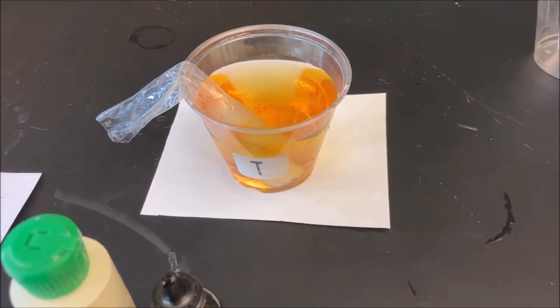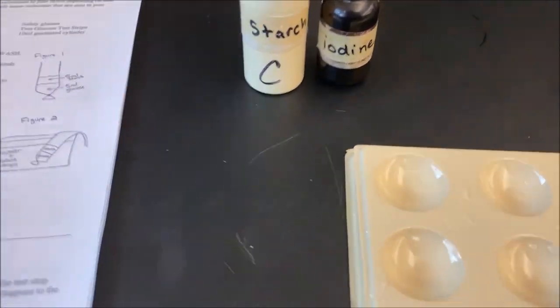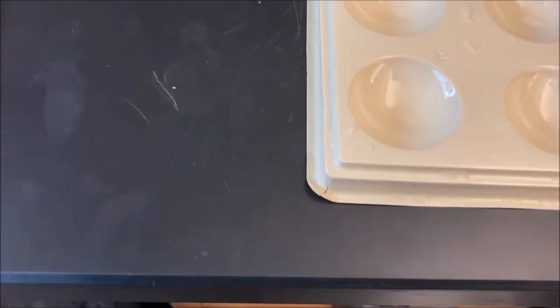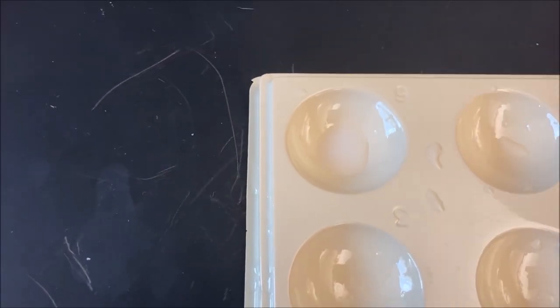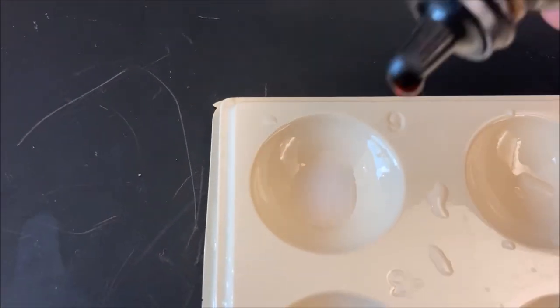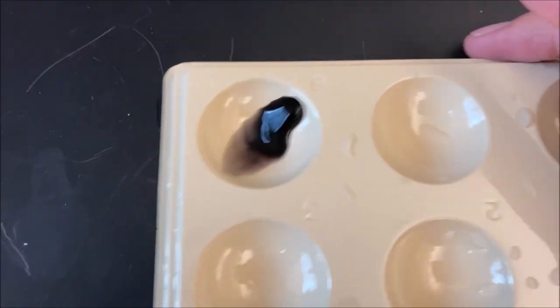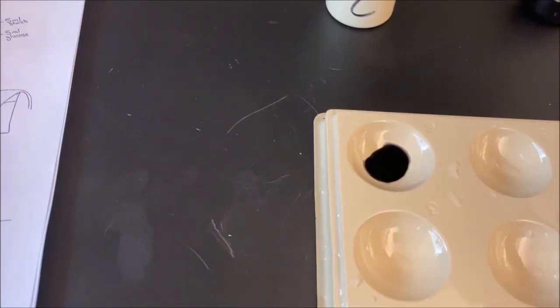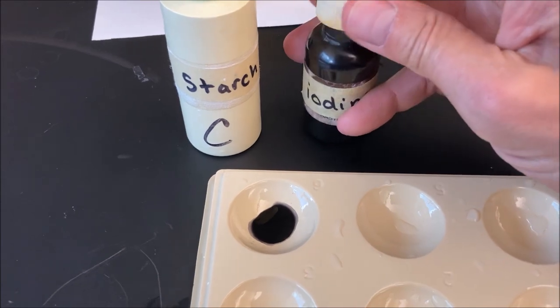While the dialysis bag is sitting in the cup of iodine water, I want to show you what happens when starch and iodine come into contact. Here's my bottle of starch — I'll add a few drops into this little well. It's a milky white color right now. I'm going to add just a couple drops of iodine into that starch solution. You can see all it took was one drop — if you stir it up, it's almost a blackish deep purple color. That's the color that results when starch and iodine mix.